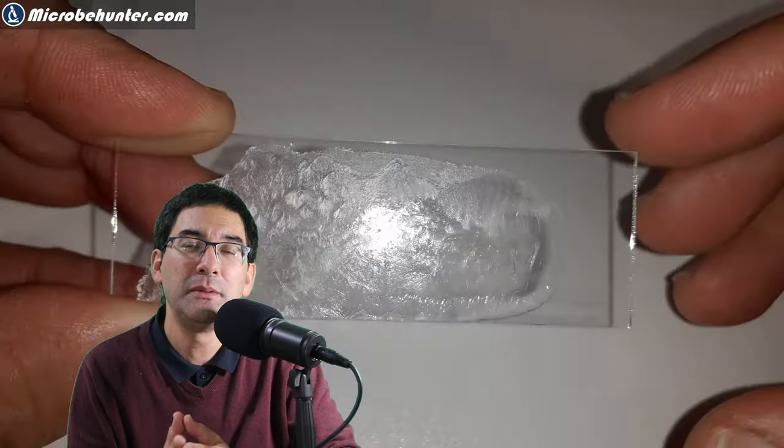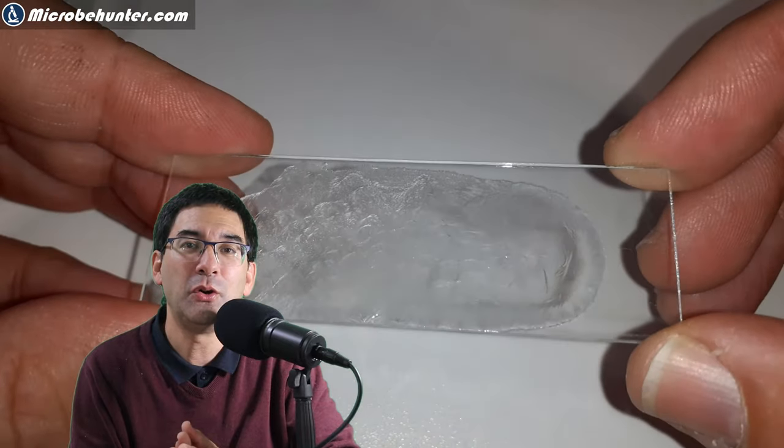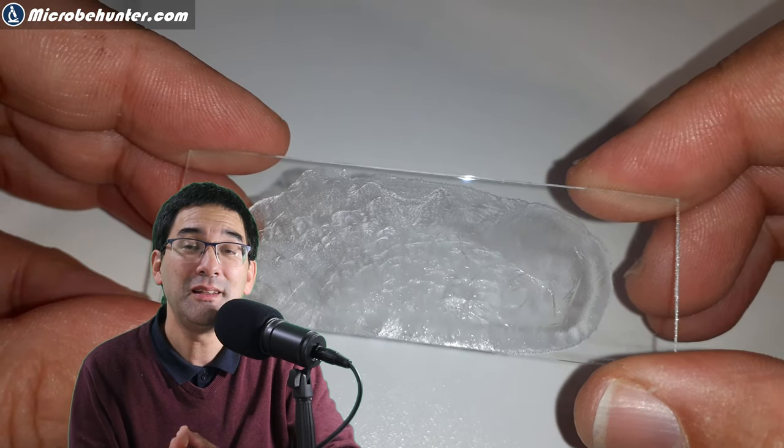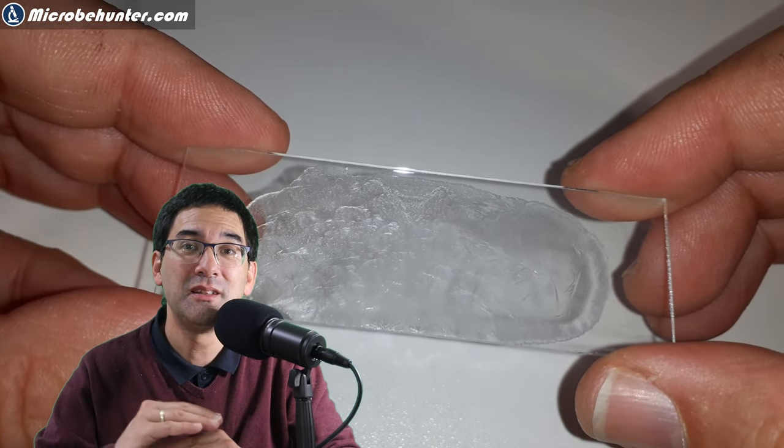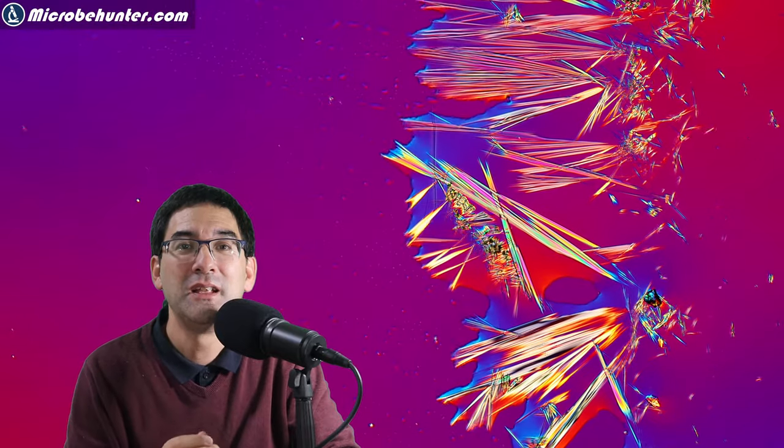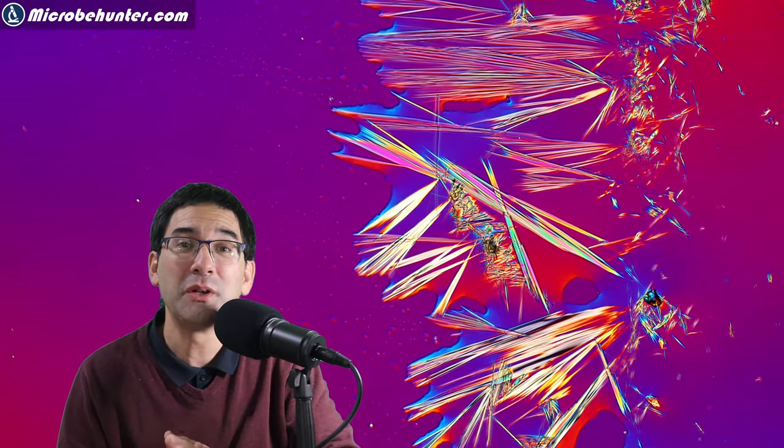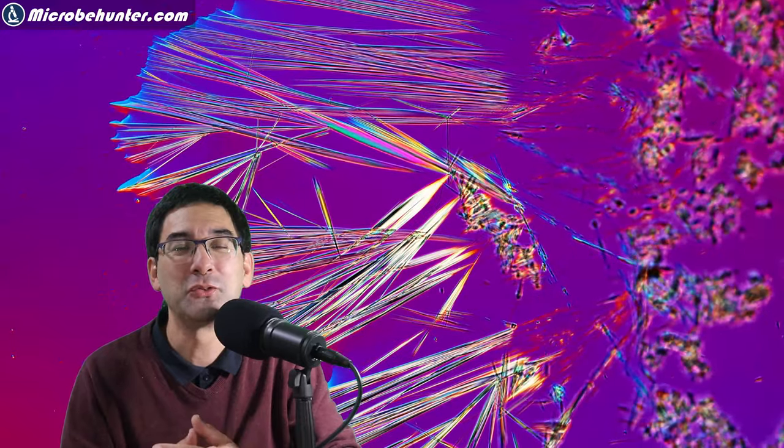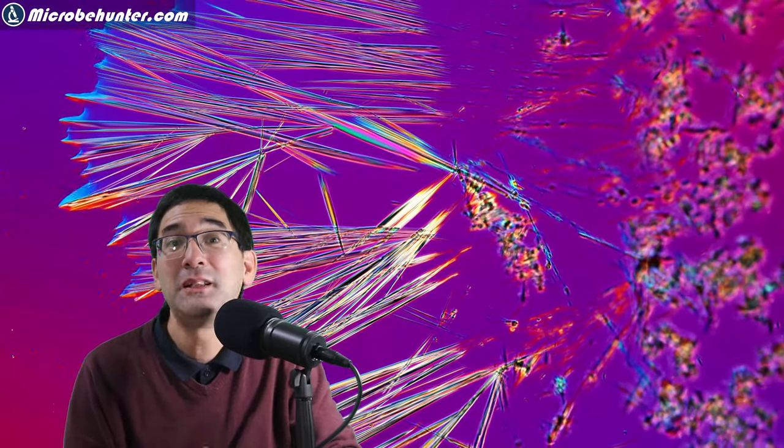I applied a little bit of water with the caffeine on the slide. After some time it looks very dry and you can see that the slide is covered with a thin layer of caffeine. Of course you don't want to wait at the beginning. You want to see the evaporation process under the microscope, and this is where you see those beautiful crystals being formed.